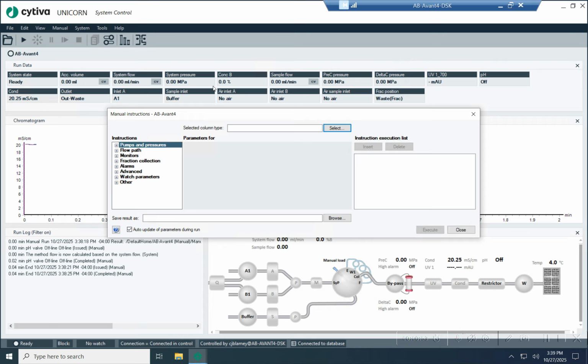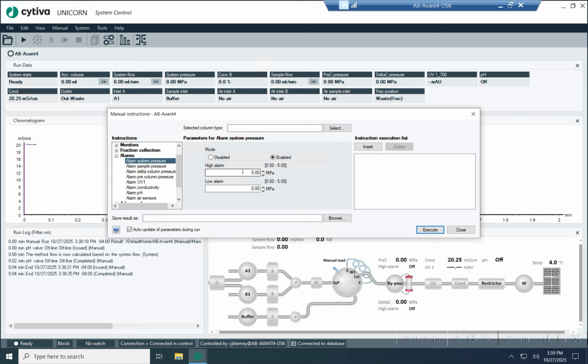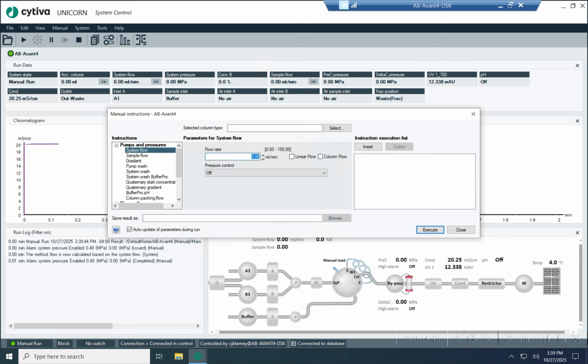All right, to actually demonstrate this, I am going to set an alarm first. 0.4. It's a little bit higher than what we've normally been doing. Now I'm going to turn on the flow rate. Then I'm also going to set this pressure control right here to system pressure. That's the same alarm that I just set earlier. What I want you to notice is that when I hit execute, the flow rate is going to go up very slowly compared to what we've been doing earlier in this video. Okay, it took us a minute, but we eventually got there.